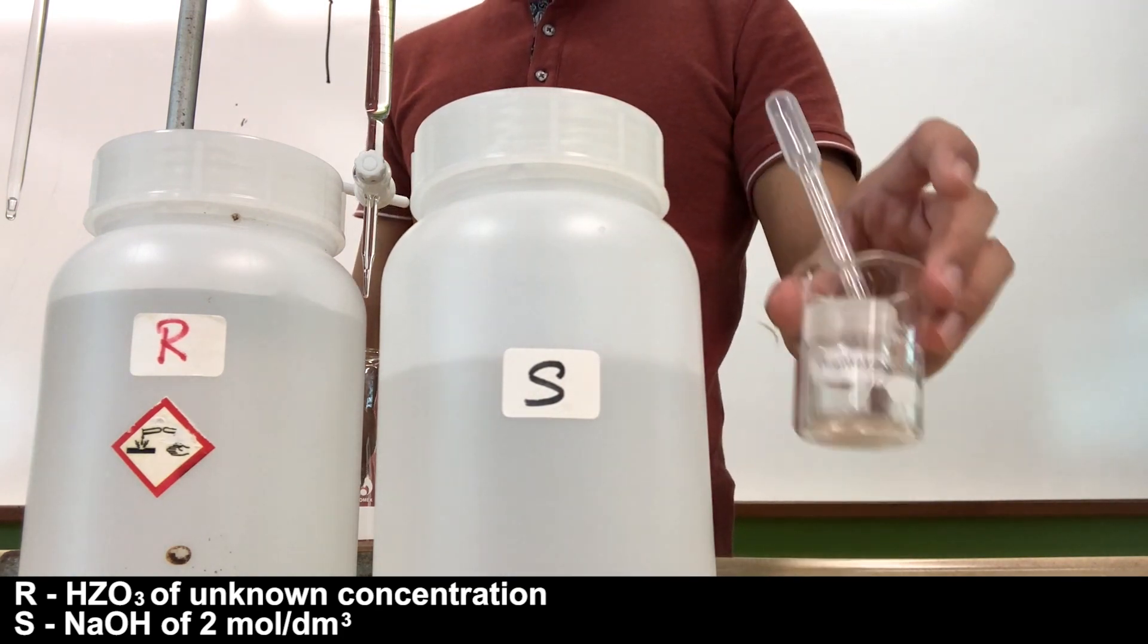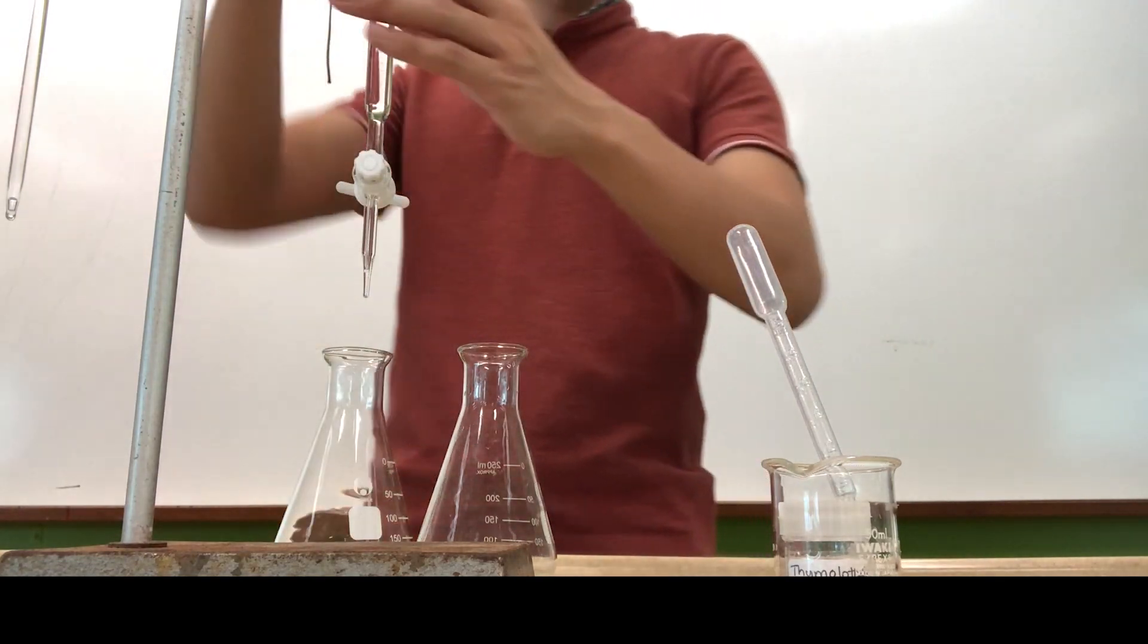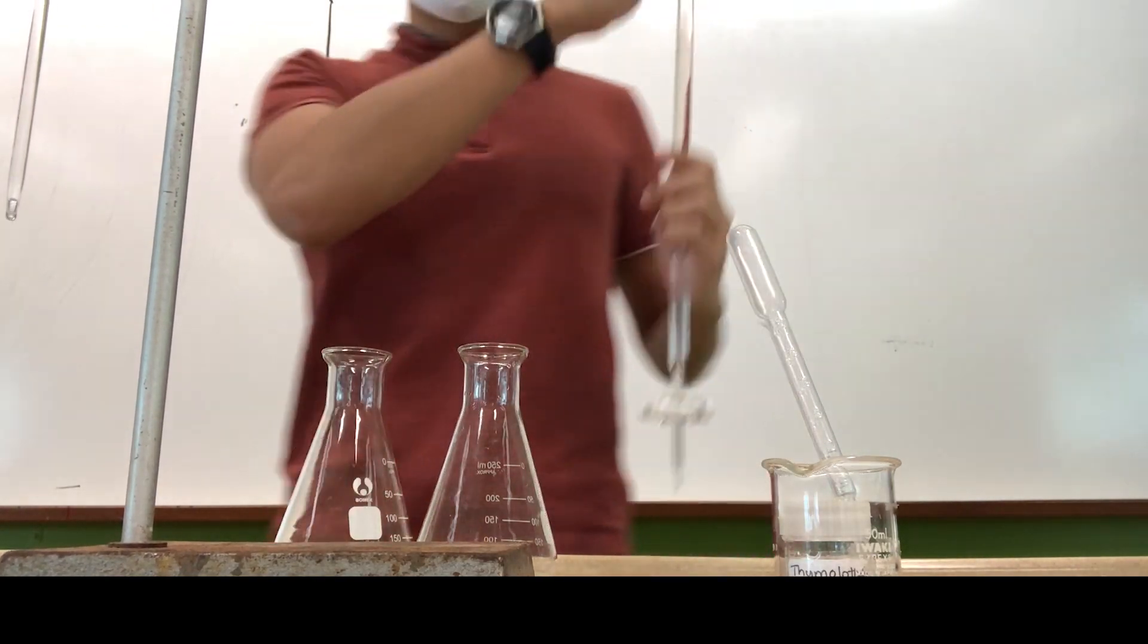Now this might be the first time that you are seeing this indicator. It's not often used, not like methyl orange or universal indicator. Nonetheless, it's all about color change and we'll take a look at it using this video.